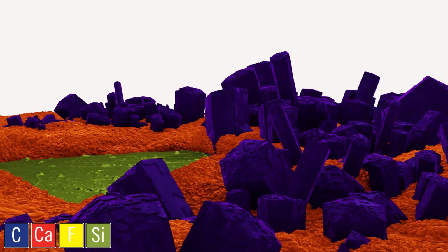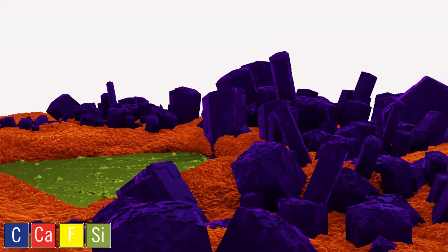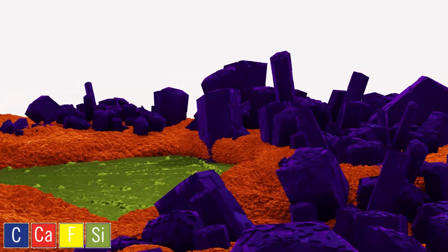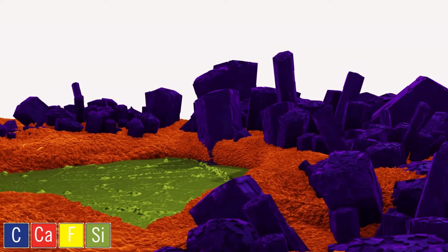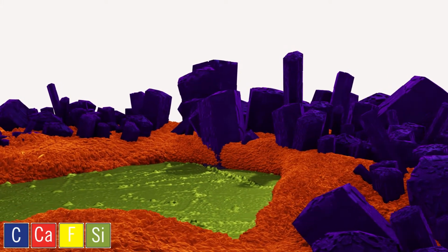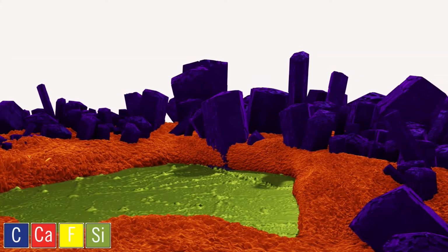Welcome to the wonderful world of chromatic elemental imaging, or CEI. Through this technique, we can visualize the composition of the foulant to understand it better than we've ever been able to before, and to tell the full story of the life of this membrane.